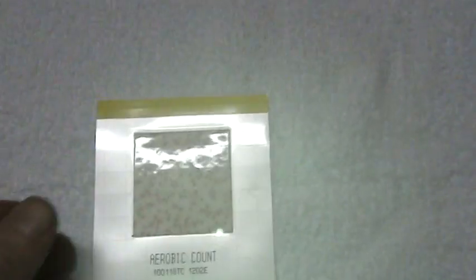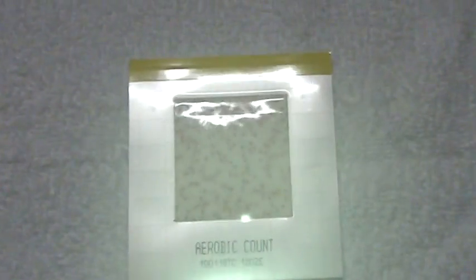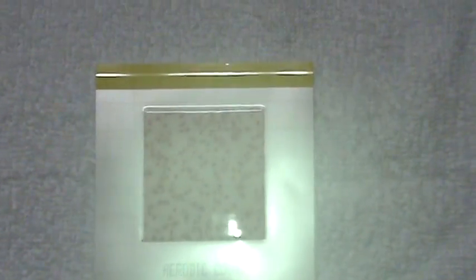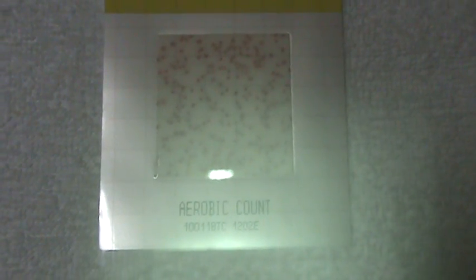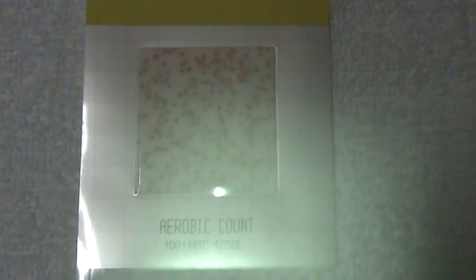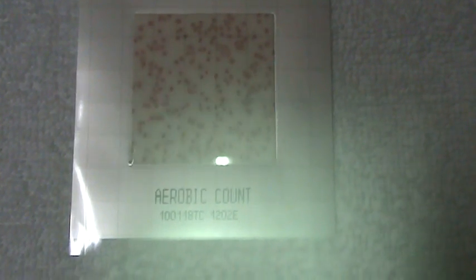And 24 hours later you'll have the final result. I'm going to close the stove now. And those final results will look something like this, covered with little red dots, colony forming bacteria. These you have to count.